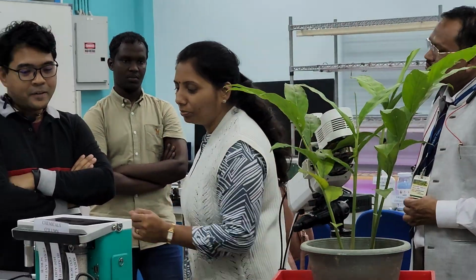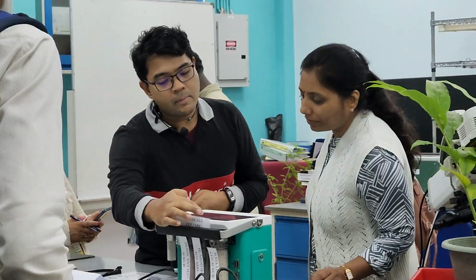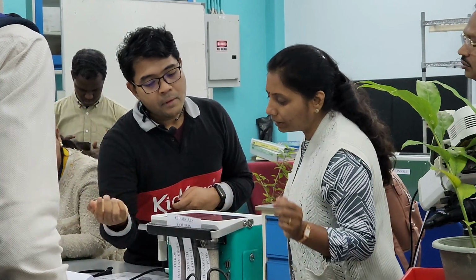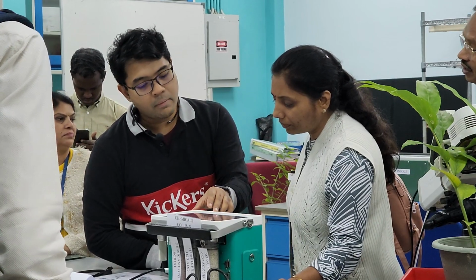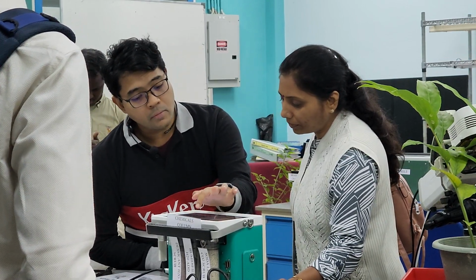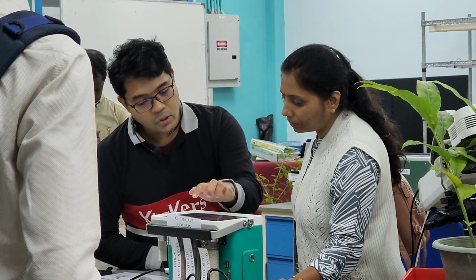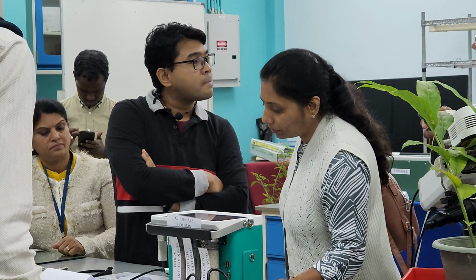Today we have taken part in the celebration of World Soil Day, and they were present there. Other observations you can see here: you get the assimilation, CO2 sample, Ci, the intercellular CO2, and Qin, the light in the chamber. You can add more actually. Water conductance is gsw. G is the universal symbol for conductance.